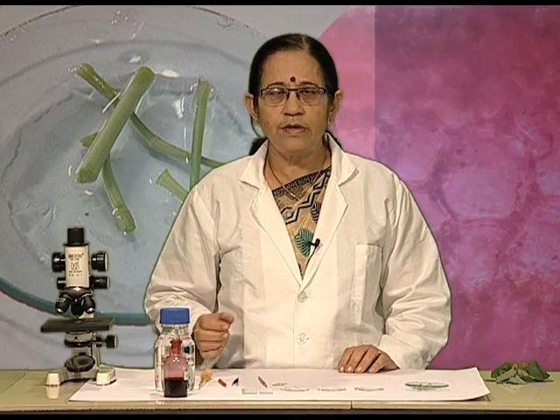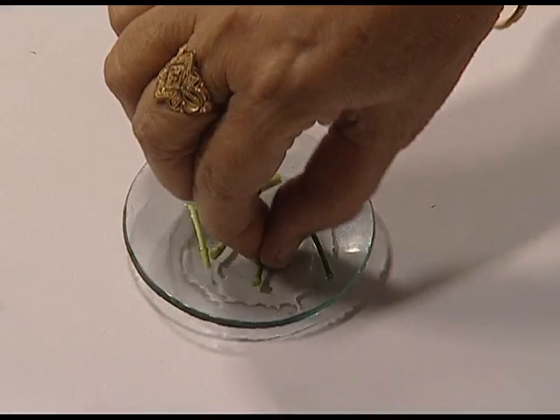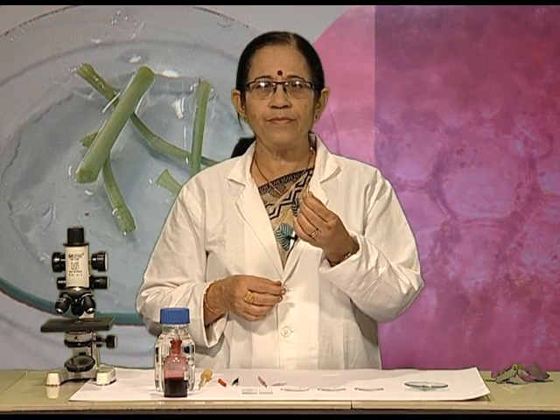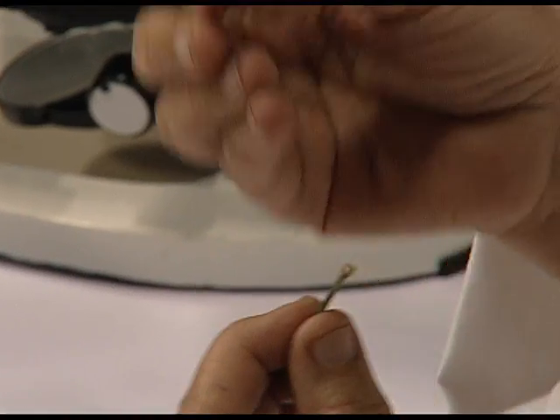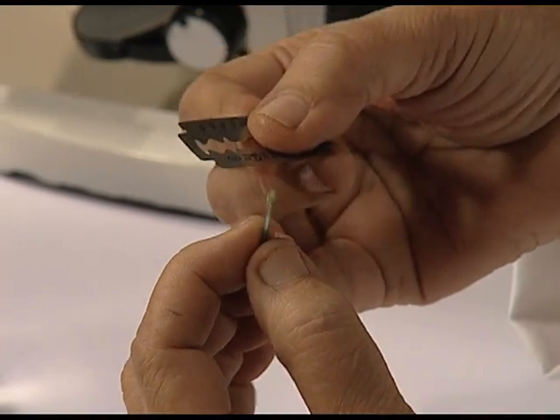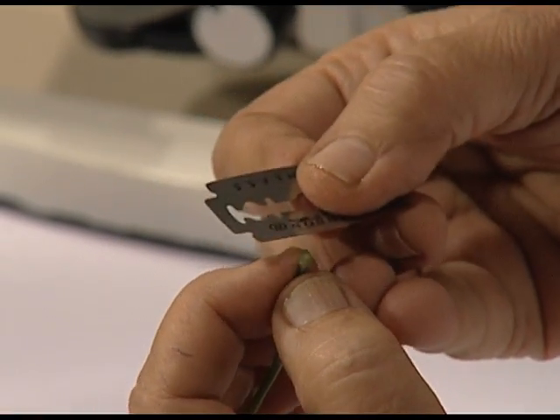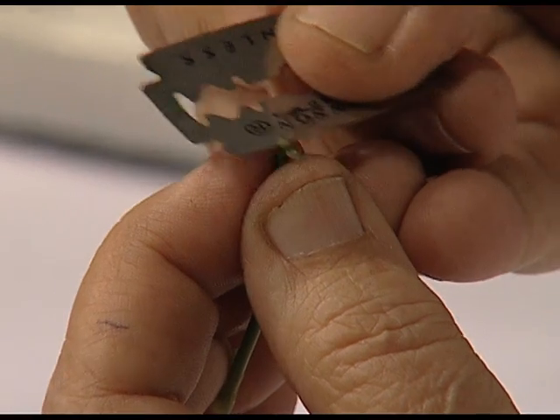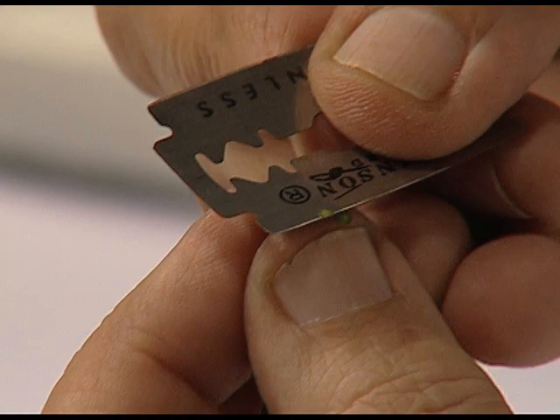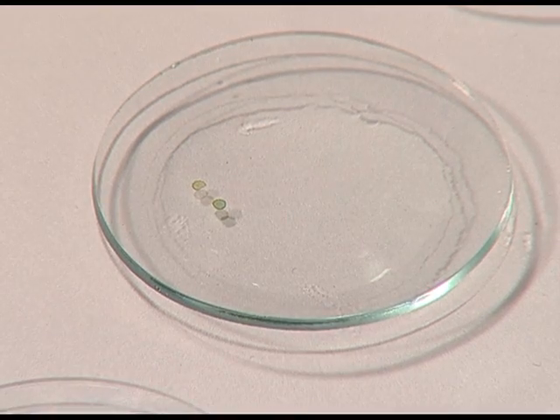Now let us start the cutting of the section of a stem. For this, you need to hold the stem in your left hand in an upright condition and hold the razor blade in your right hand at right angles to the axis of the stem, and try to cut very thin sections of the stem — as thin as possible — and then put these in water. Here you can see I have cut sections of the stem and put them in water.